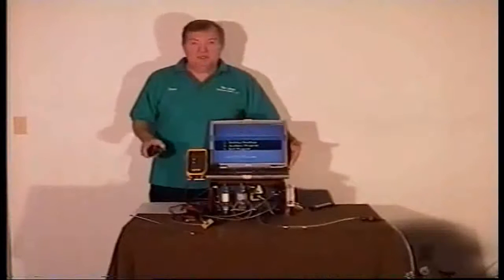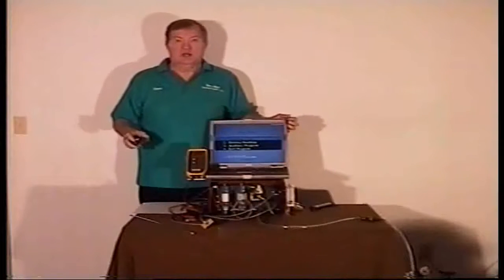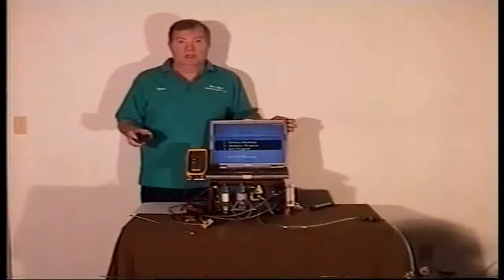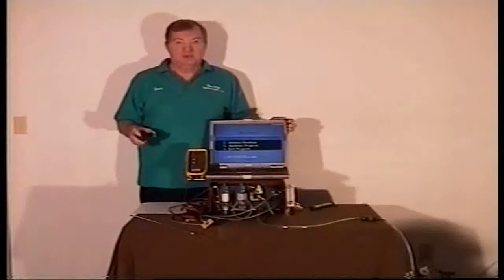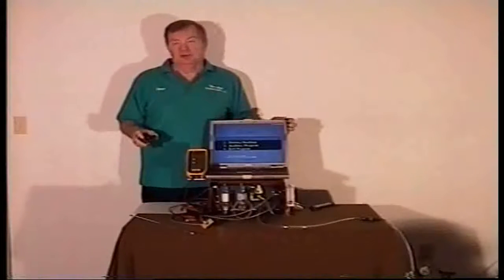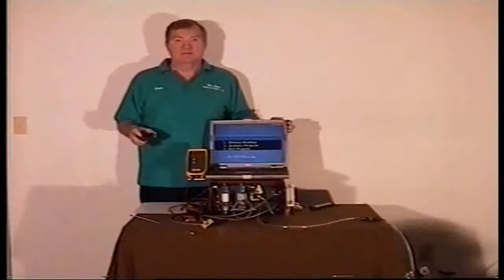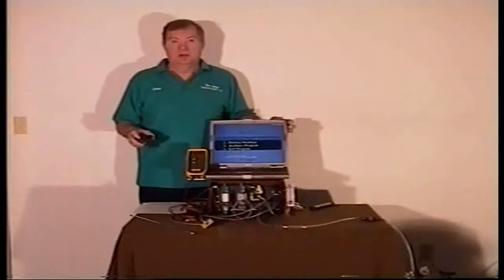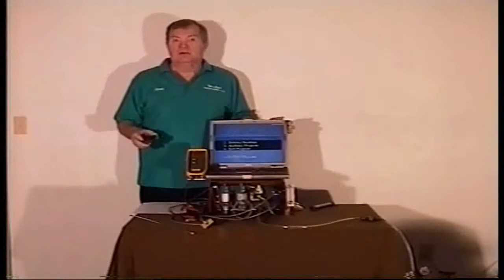With this analyzer, the PC is the operating platform for the analyzer. This addresses your maintenance issues, so if you have a problem with the PC, you can reload the software on another PC, and you're up and running again. Also, the software is licensed to the analyzer. It's not licensed to the computer. You can have multiple copies of the software running on multiple computers. I've got a number of universities that are using these. They have labs in different places around campus, and they have the program loaded on those computers in those labs. So when they go from point to point, all they have to do is carry the analyzer. They don't have to mess with the computer.